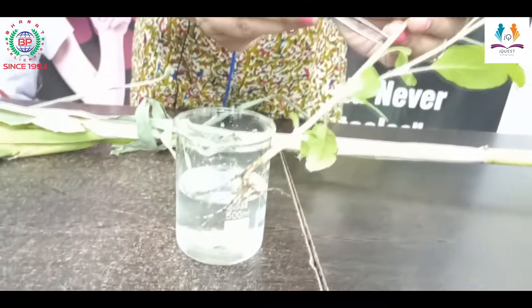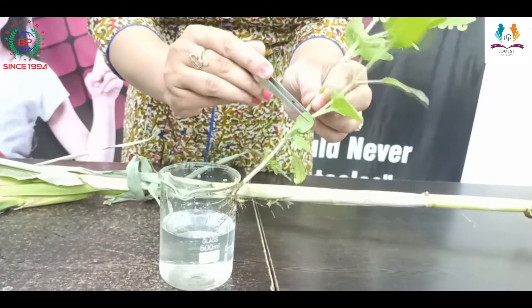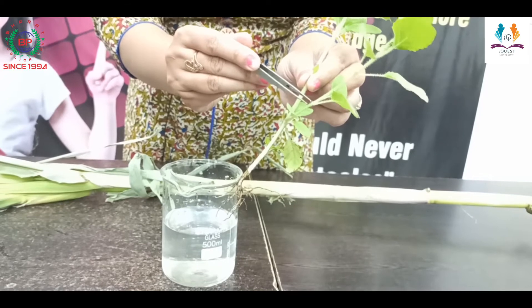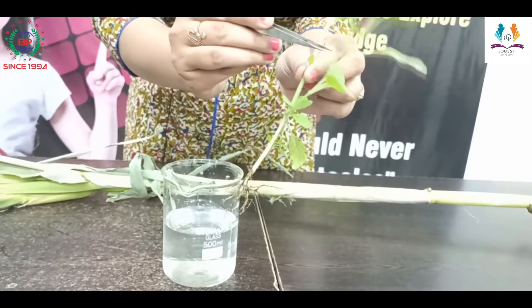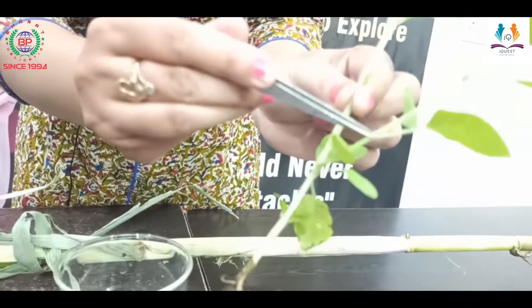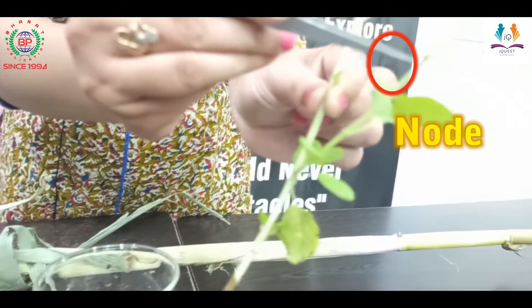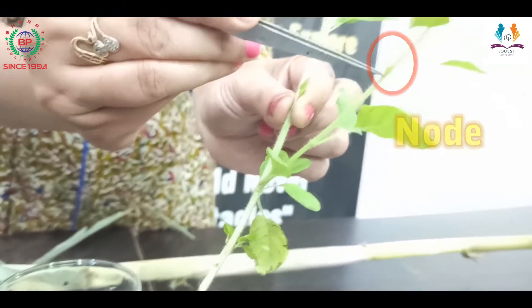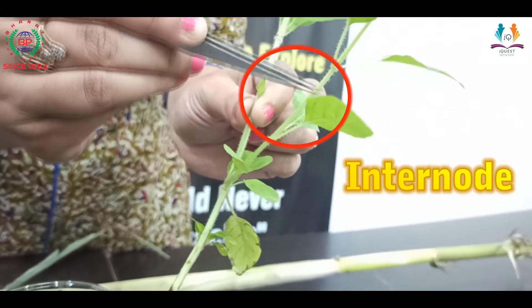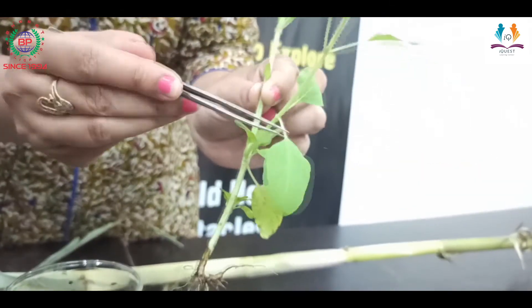Next is the stem. You can see the stem of the tulsi plant and the branches coming out from it. The point from which the leaf arises is known as the node. The distance between two nodes is known as the internode.